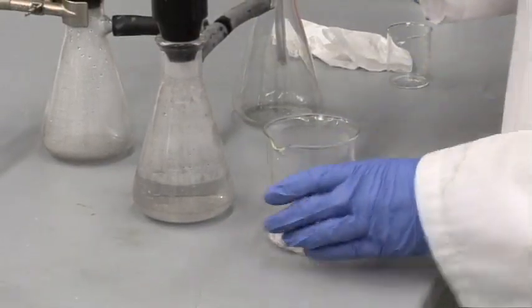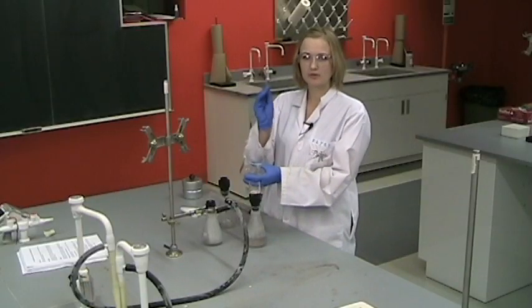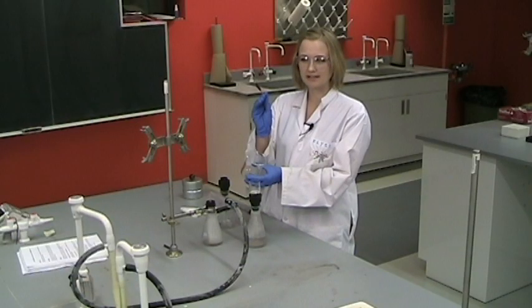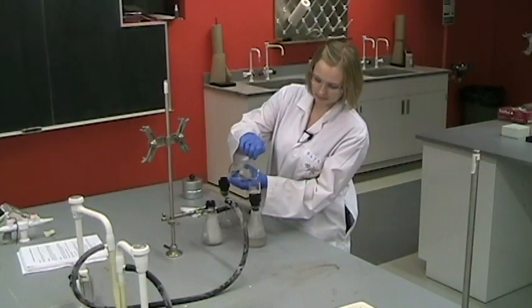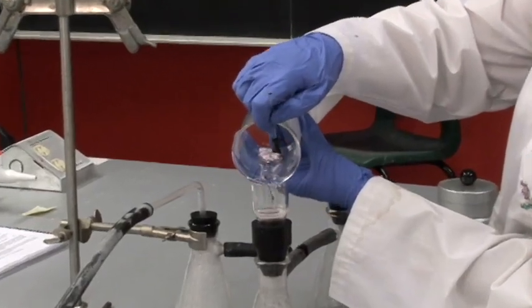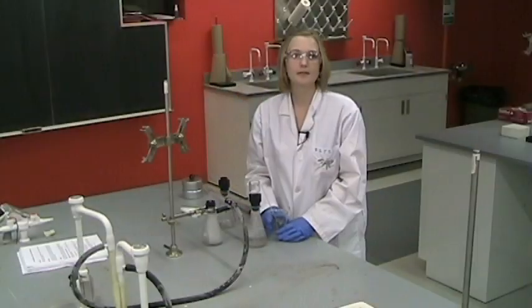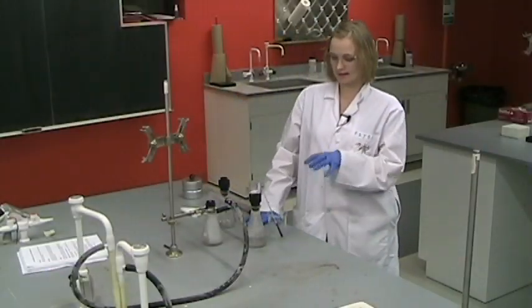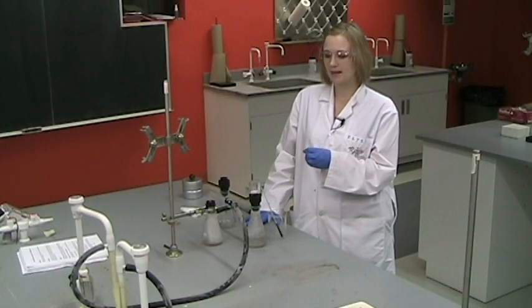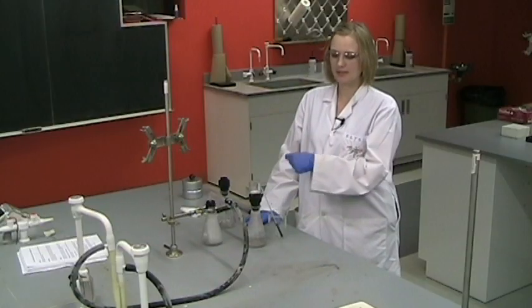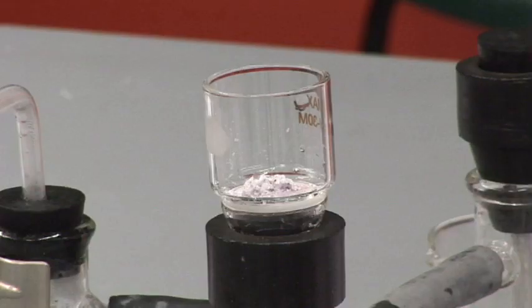And then you add a few more milliliters of nitric acid to the salt. And this time we actually want to transfer the salt into the filter. So this rubber piece on the end of the glass stir rod is called the rubber policeman. With the nitric acid and the rubber policeman, we will transfer the precipitate onto the filter. If you need some help getting the precipitate onto the filter, you can also use some water from your wash bottle to add some water to the beaker and to help you move it onto the filter.